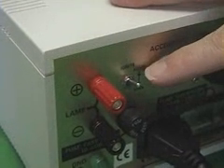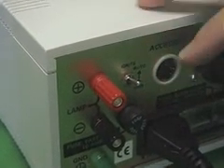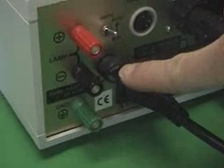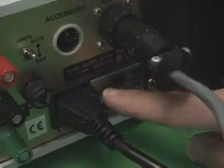Connect the power cord into the power socket like this. Just push it in. On the back of the power supply is a toggle switch labeled Ignite which can either be set to auto or to manual. The igniter fuse is below here, and the fuse for the whole lamp power supply is behind this little sliding plastic door. You have to pull the plug out to get access to that fuse.